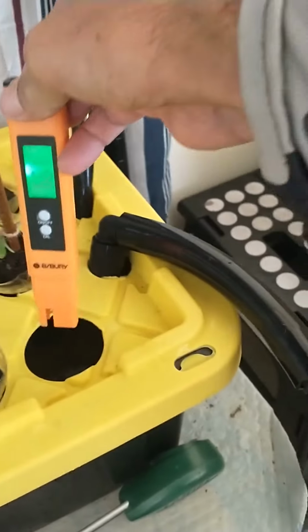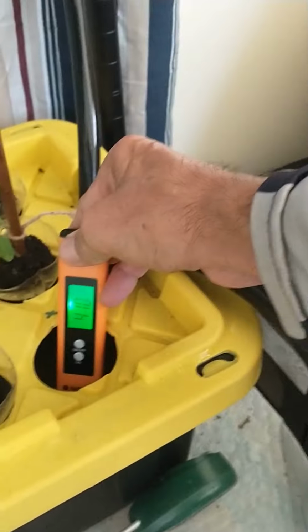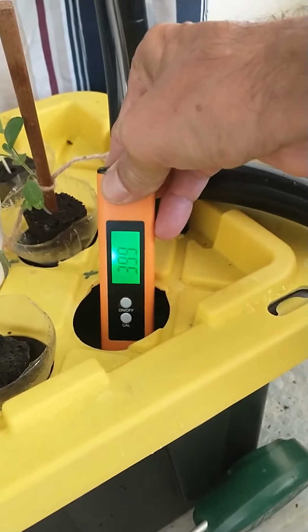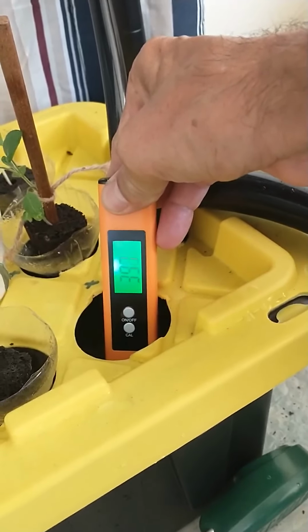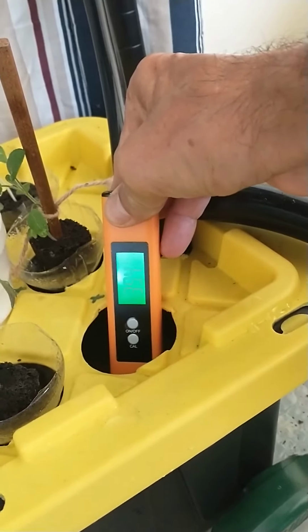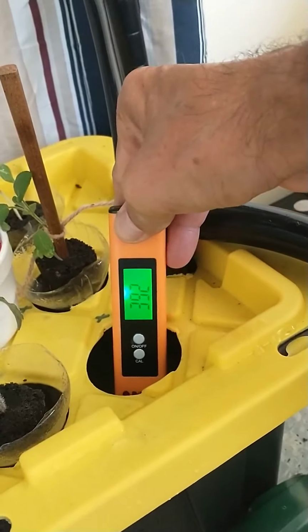Even though it went up a little bit. It was at 300 something before. I wanted to be up closer to 6 and 7, but am I doing something wrong here? Where am I supposed to be at? I'm thinking I'm supposed to be at 600 and something plus, but if I'm doing something wrong, somebody please tell me. I'm definitely not getting the results that I want.